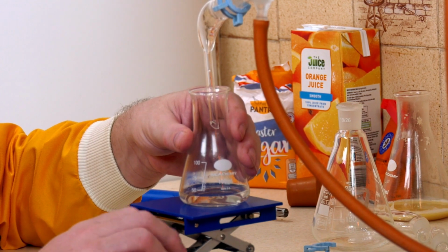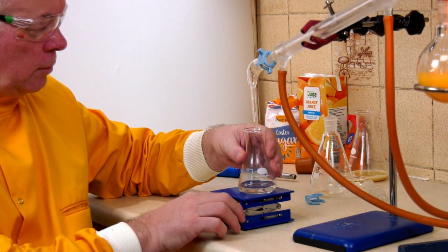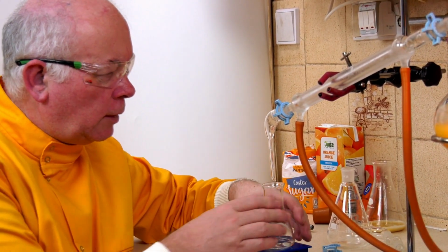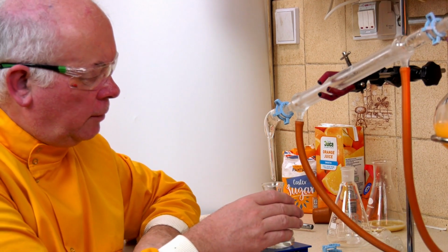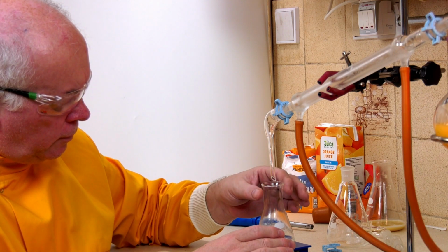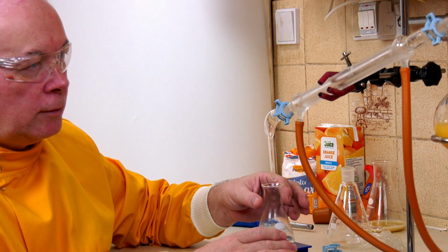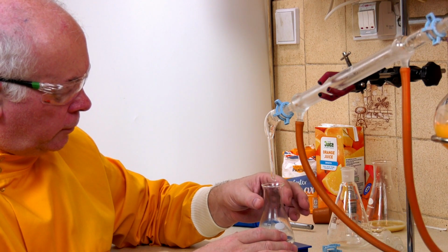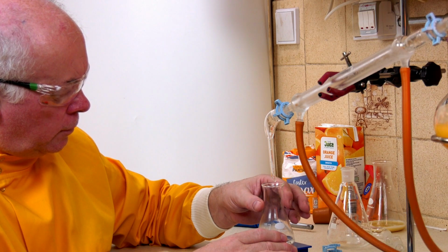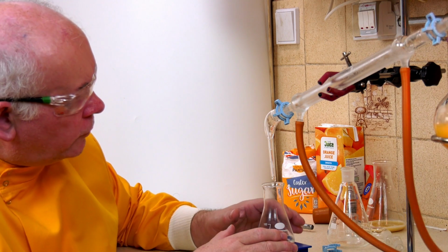Right, let's see what we've got. And we've got a little smell of alcohol coming off there. Heavily scented with orange juice, I might add. And this will gradually stop.